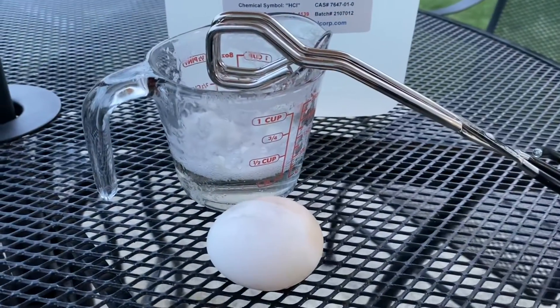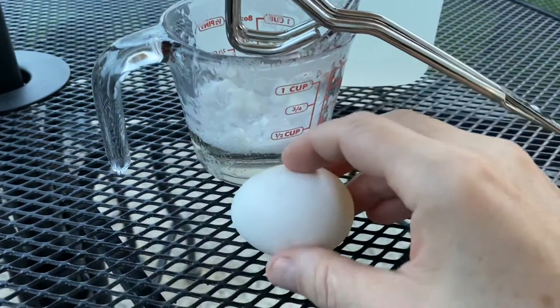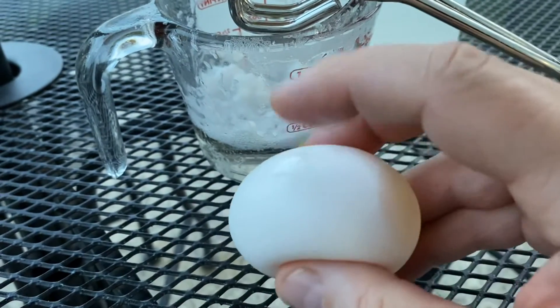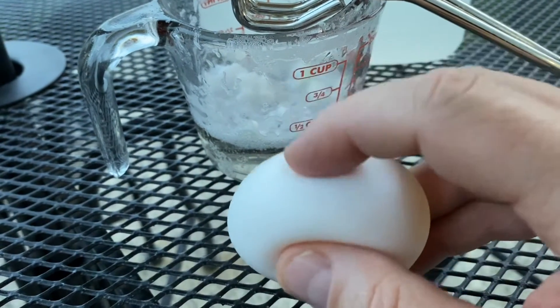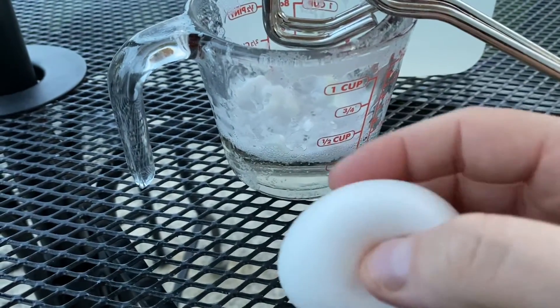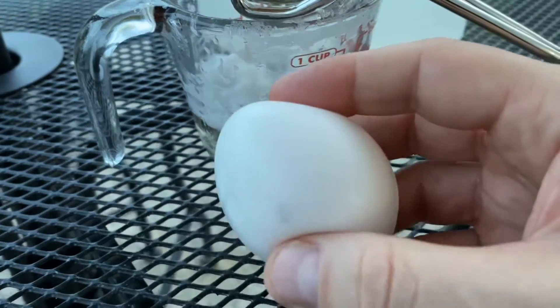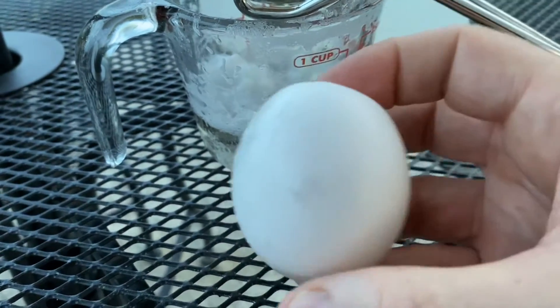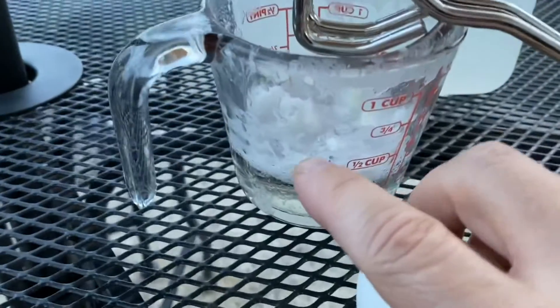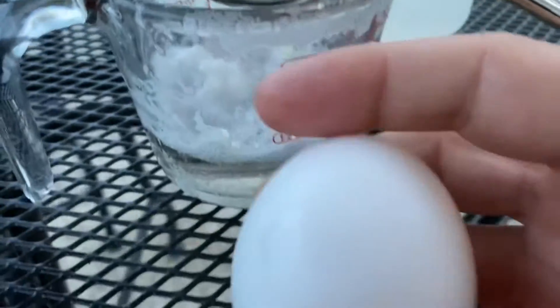And now the final result. After about five minutes, all of the calcium carbonate that makes the eggshell has dissolved in the hydrochloric acid into calcium chloride, water, and carbon dioxide. And you can see all the carbon dioxide bubbles there.